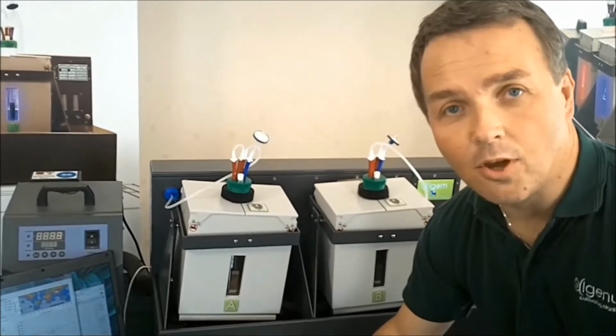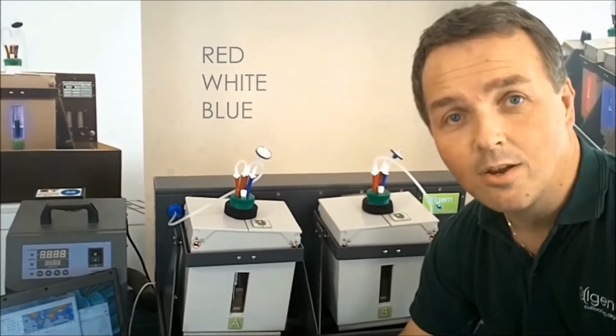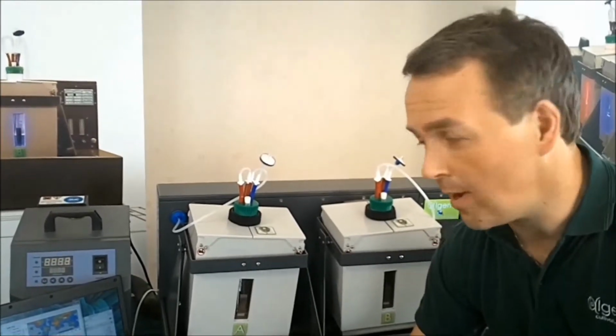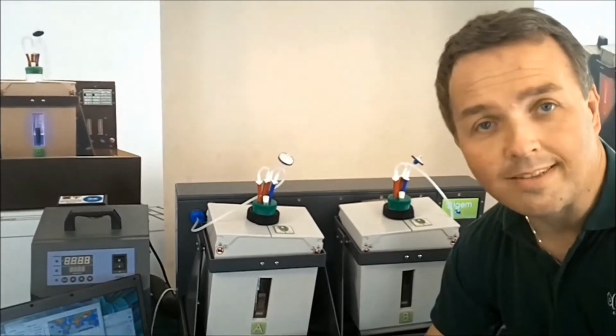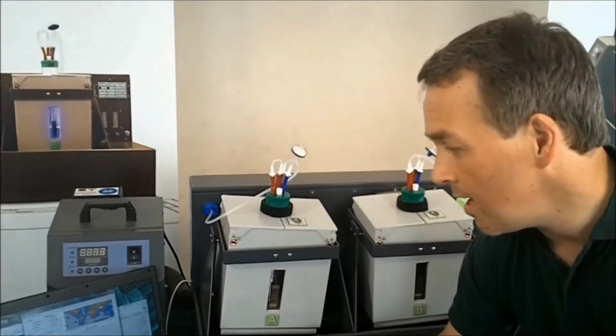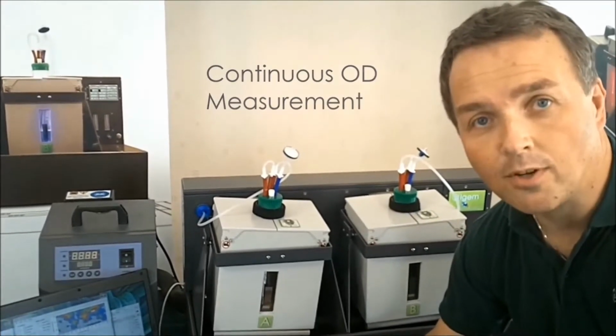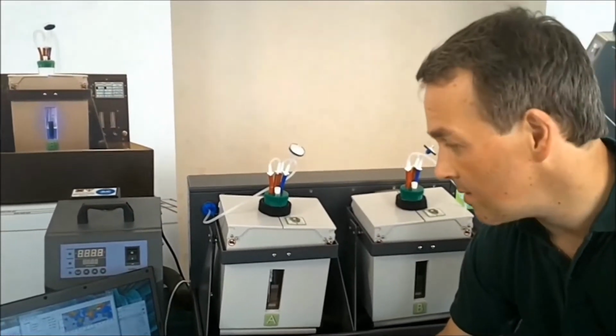Under the lighting, you have the option of 3 different LEDs. We have red, white, and blue LEDs as standard, which you can use singly or you can make customized blends. Your mixing also, you can do a pulsed mixing option or a constant mixing option. And then lastly, continuous OD measurement. You have the option of how often you read the OD through the flask.